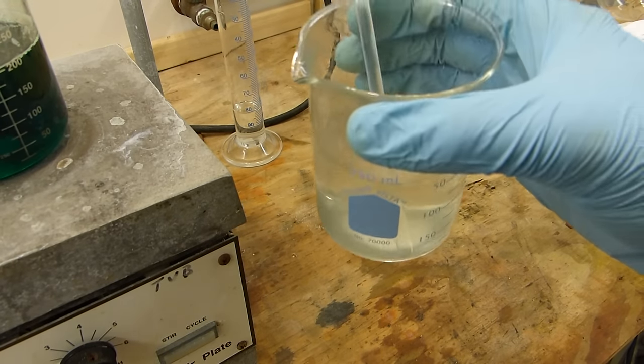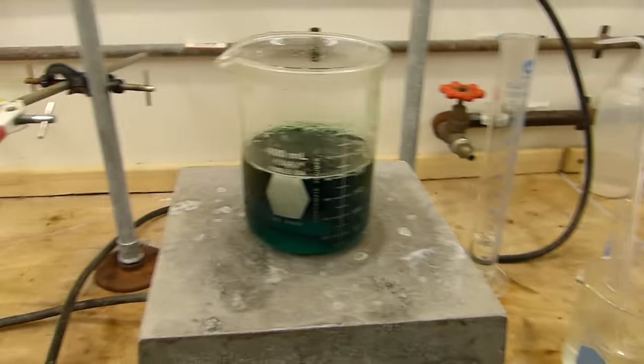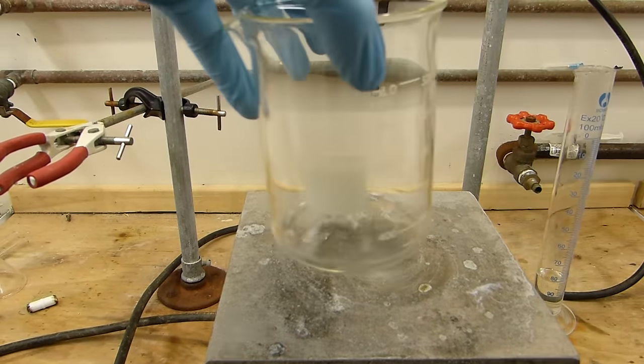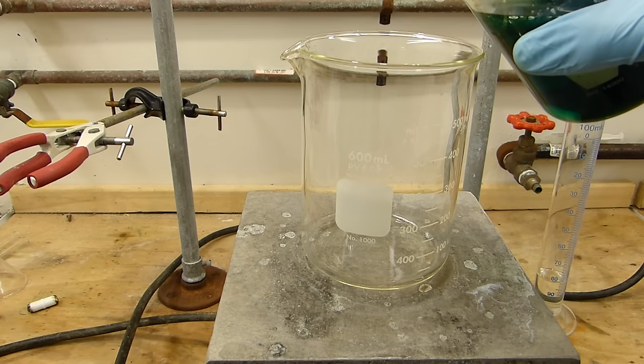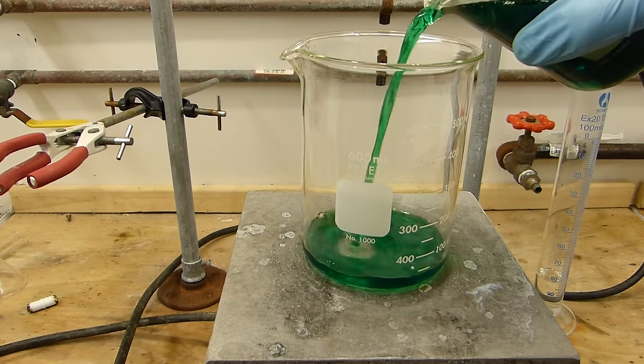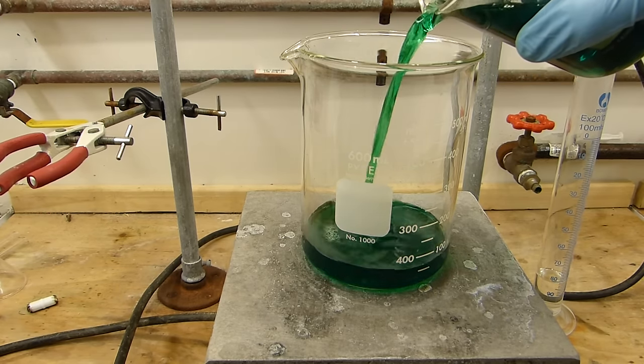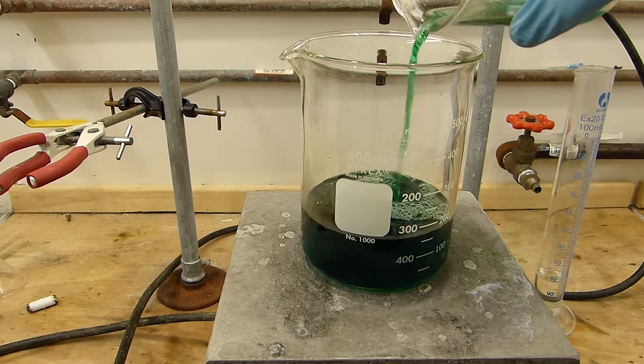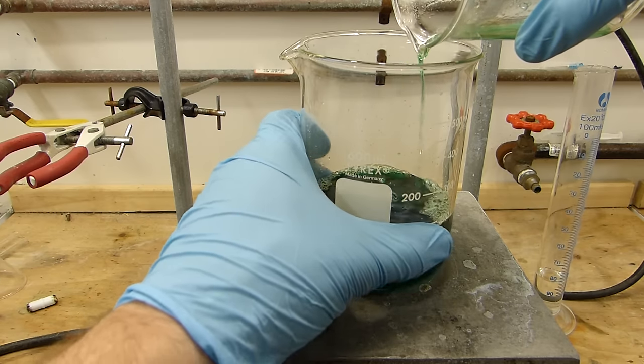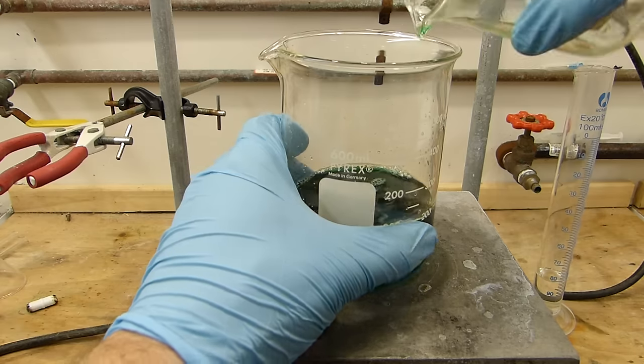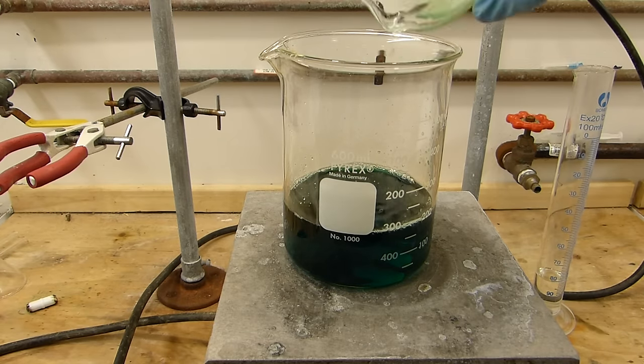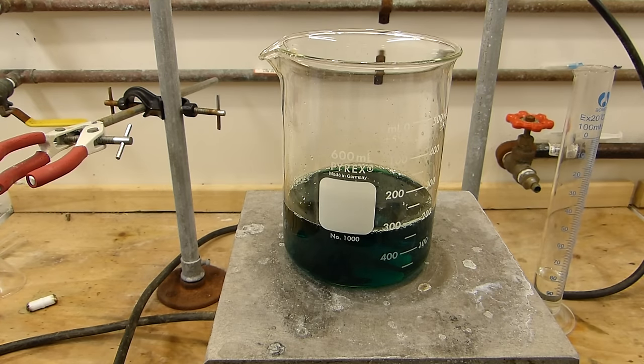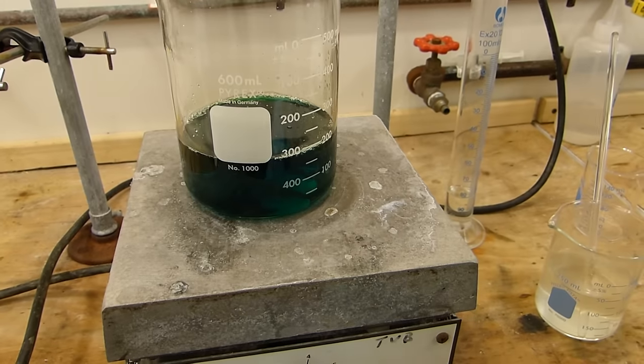The oxalic acid is now dissolved and so we can prepare the main reaction vessel. So we'll start by taking the solution of nickel chloride that we made and transferring it into a bigger beaker to perform the reaction in. I'm going to pour this slowly in an effort to decant off any of the heavy impurities that may have been in the original basic nickel carbonate. Very carefully and then I'll tilt it so I can transfer the stir bar. Pour off a few grains of sand it looks like. We have our nice clean reaction mixture now.